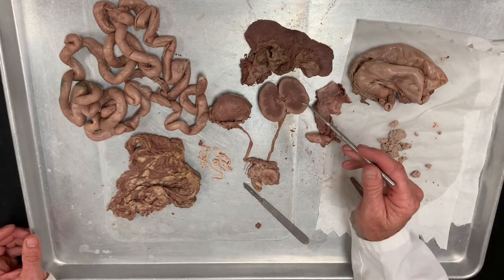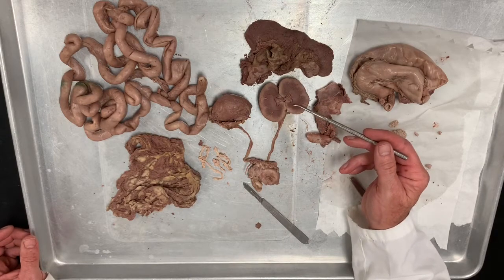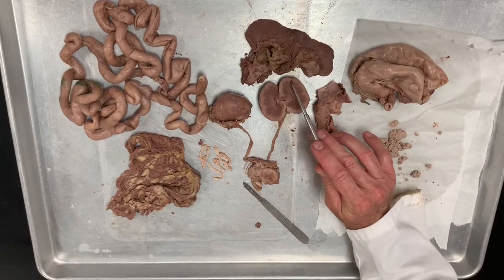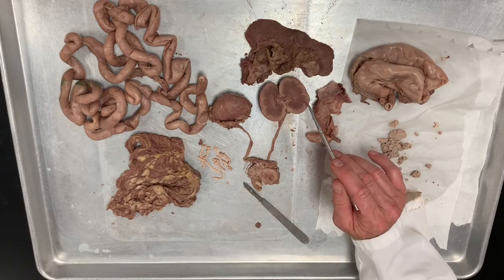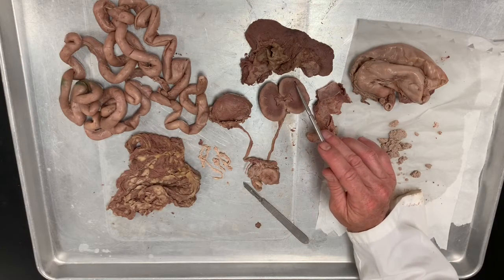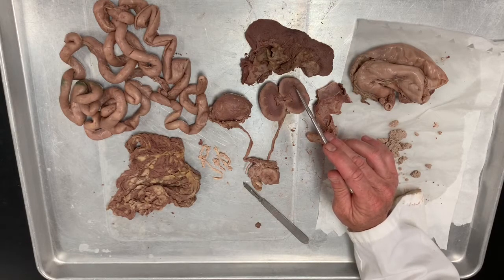This light-colored area along the perimeter, that's called the renal cortex. The darker area in the middle is called the renal medulla. And then along the perimeter, you have these things called renal pyramids. They're kind of these petal sections of the kidneys, and the kidney tubules actually dip down in these renal pyramids, and that's where the filtration happens and where nutrients are stored and waste products are pushed out.